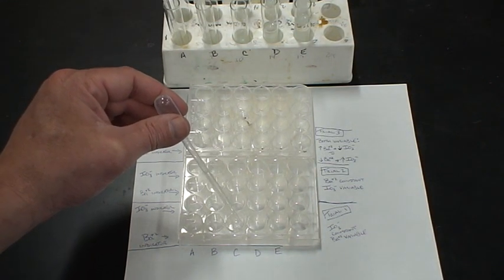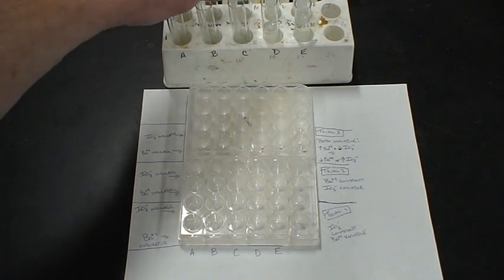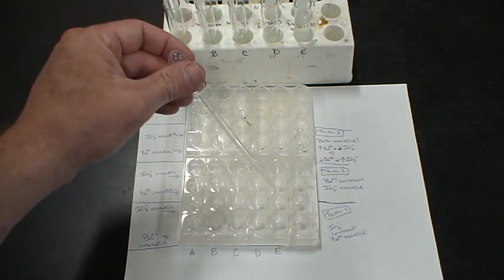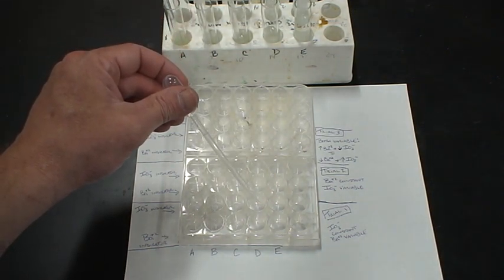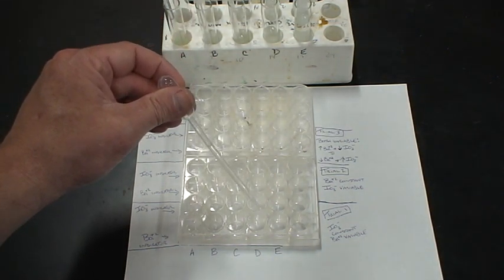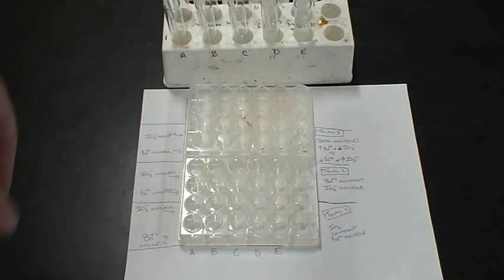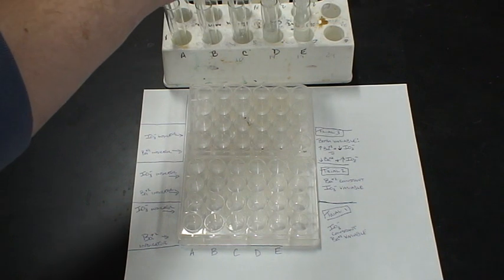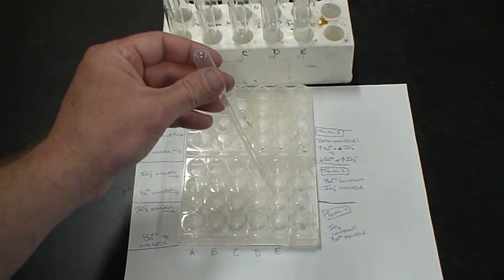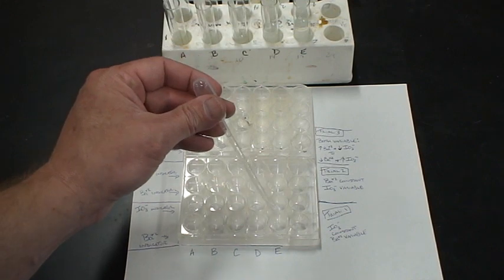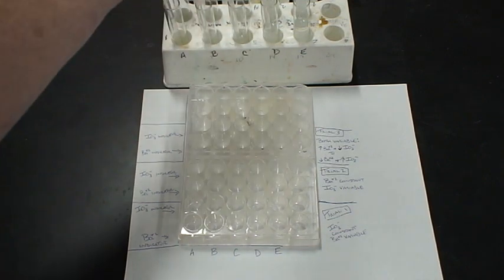To well D, one, two, three, one, two, three. And lastly to well E, one, two, three, one, two, and three.